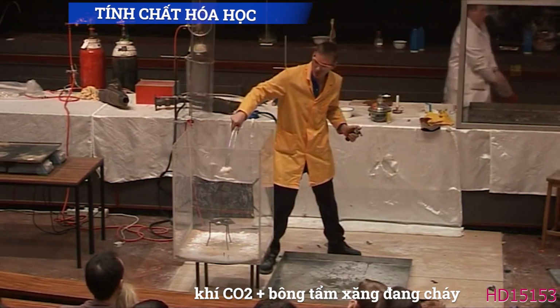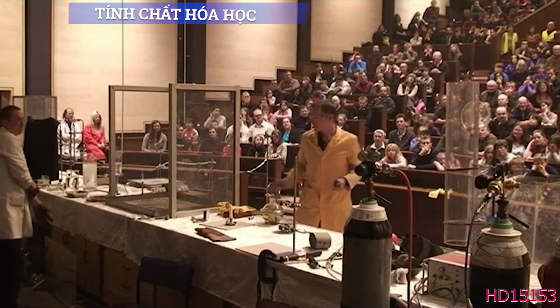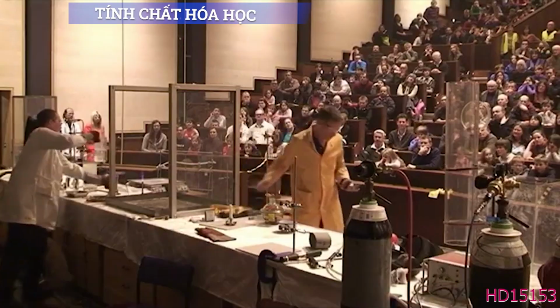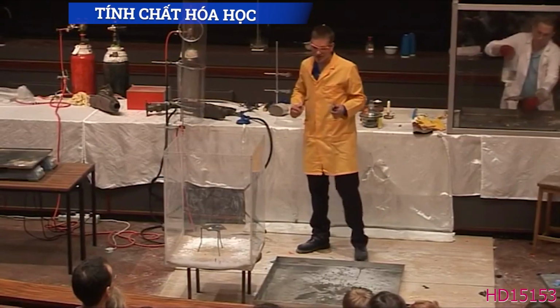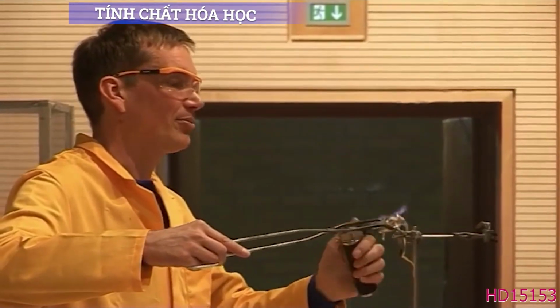Now, could this be used to put out burning magnesium? Well, let's try it. So I have some magnesium here, and I'm going to set this on fire and see if we can put this out in the carbon dioxide.